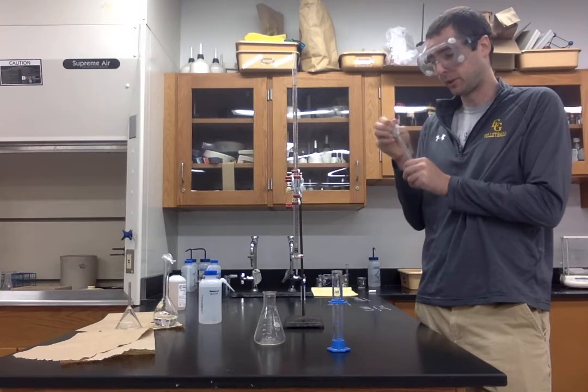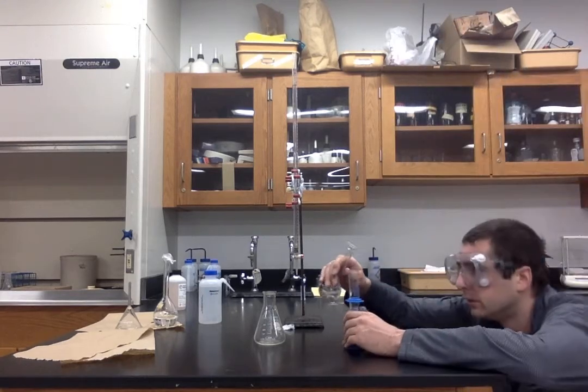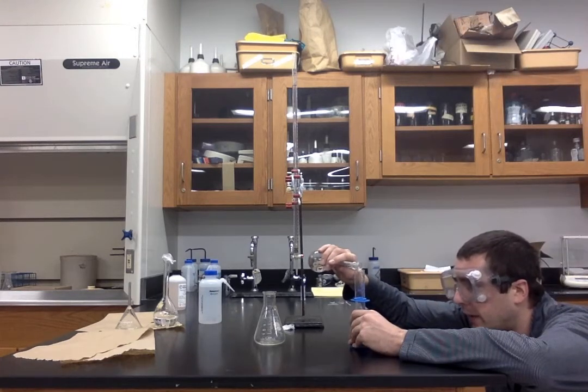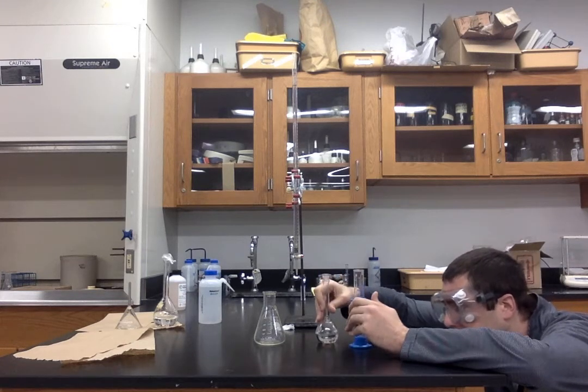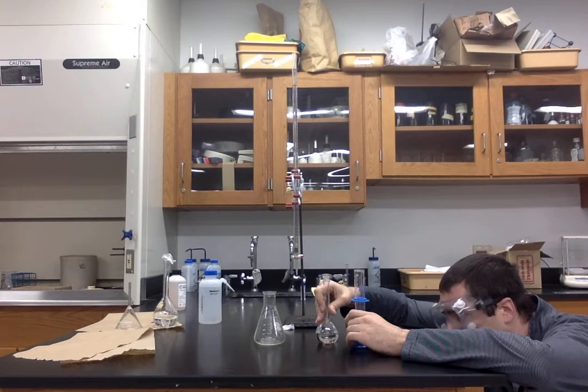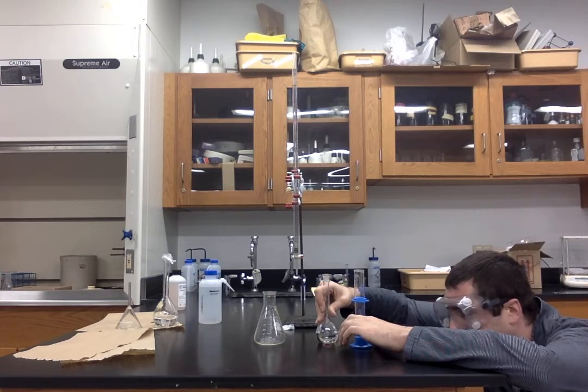So whatever that is, we just have to write down the actual value. So I'm going to get down to eye level here, try to get around 25 mLs. Okay. That is like exactly 25.